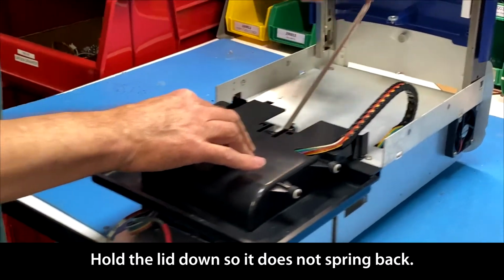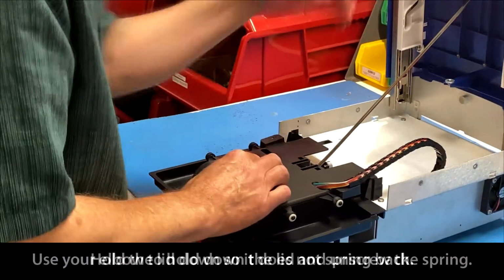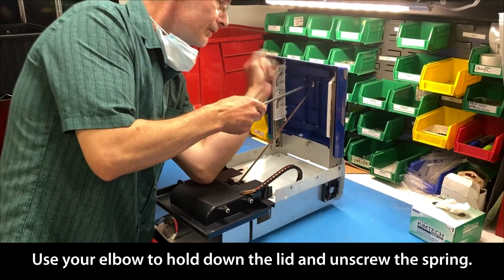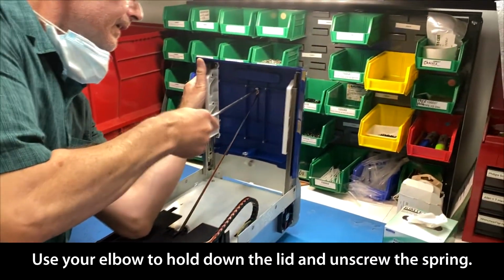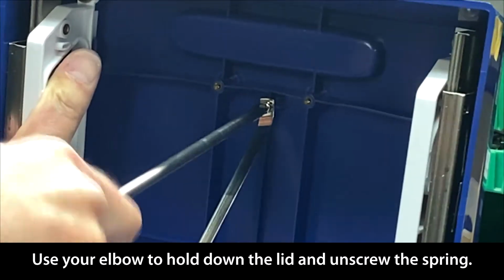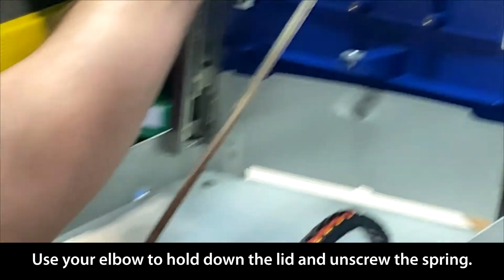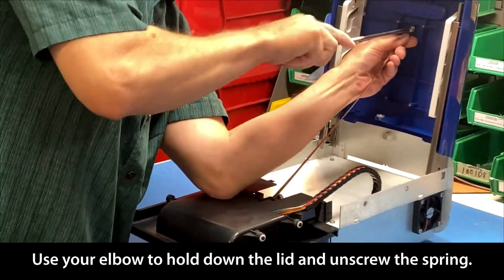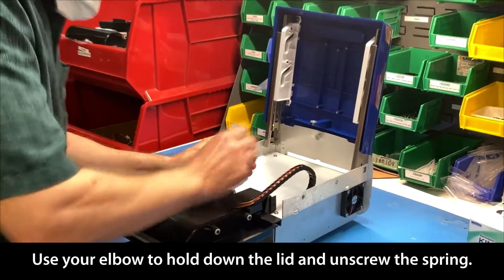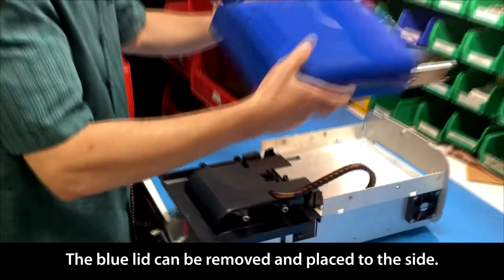Okay, at this point we've got a spring here. We want to disconnect the spring, so you have to hold your light block lid down. If I let go, it's going to snap back up. So I'm just going to hold it down with my elbow and take out the screw right here. This is a very old unit, so it's a little tough. Again, I have my elbow on the light block lid so it doesn't snap back up on me. I take that screw out, and now the spring will roll right back like that. And now I can take my blue lid off and put it to the side.